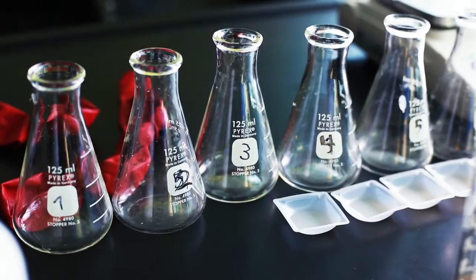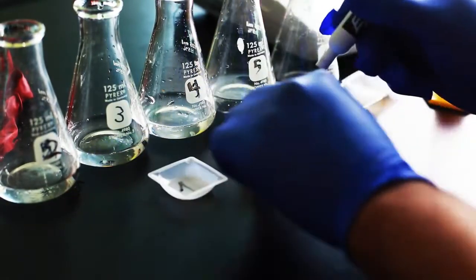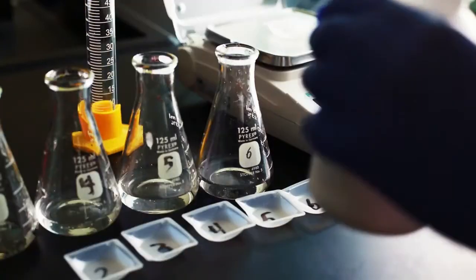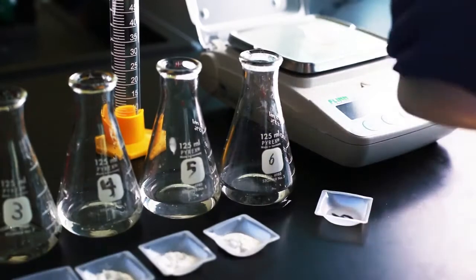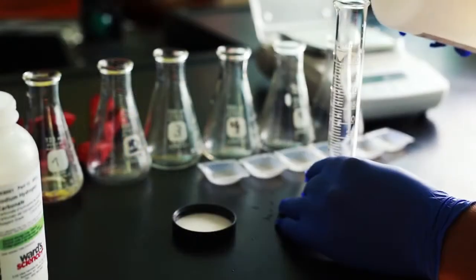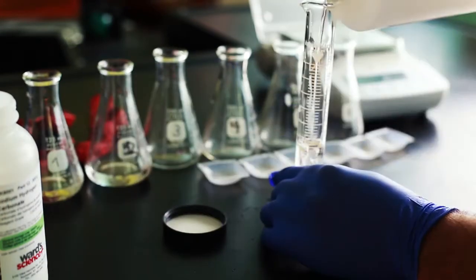I started off by labeling all the Erlenmeyer flasks one through six, then did the same with the weighing dishes. I added 0.5 grams of sodium hydrogen carbonate to the first weighing dish, one gram to the second, 1.5 grams to the third, two grams to the fourth, 2.5 grams to the fifth, and three grams to the sixth. I then used the graduated cylinder to measure out and pour 25 milliliters of acetic acid into each Erlenmeyer flask.